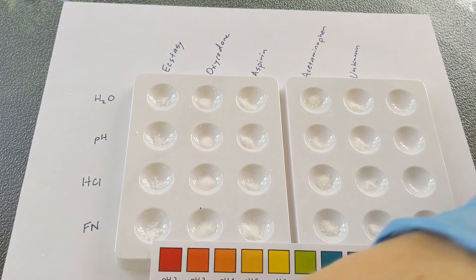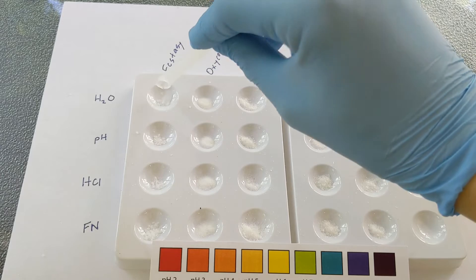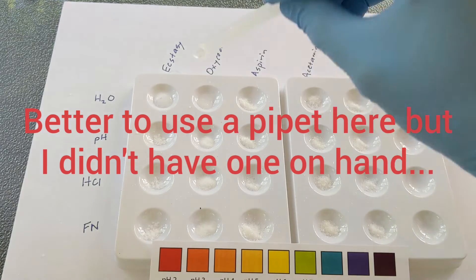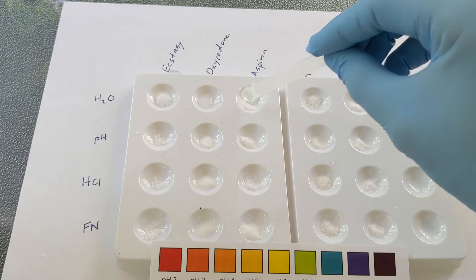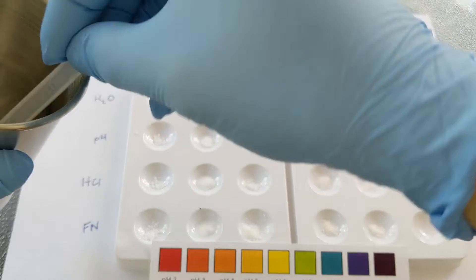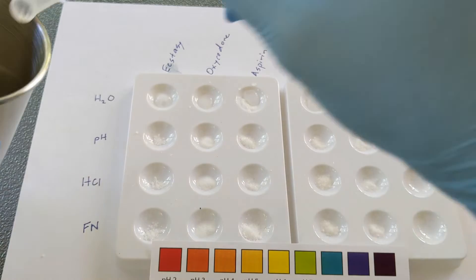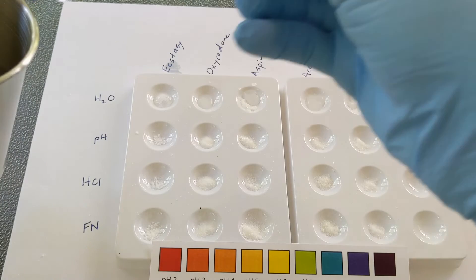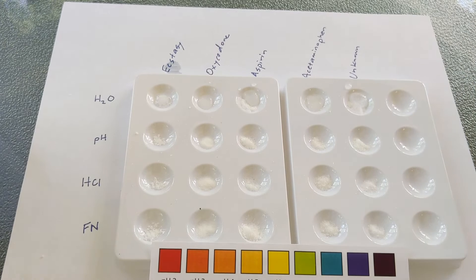The first thing I'm going to do is add some distilled water to the first row. We have some bubbling with the ecstasy, so that means we do have a chemical reaction between water and ecstasy. However, it looks like oxycodone and aspirin are not experiencing a chemical reaction, nor is the acetaminophen. The unknown also does not appear to be bubbling. Think about what we can rule out in terms of what the unknown is.